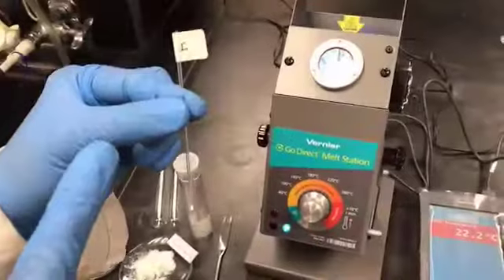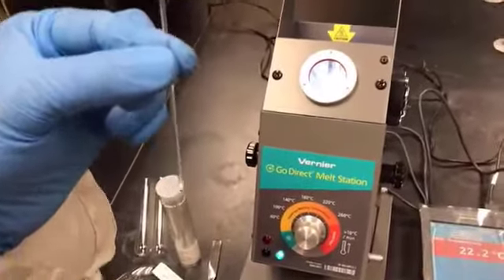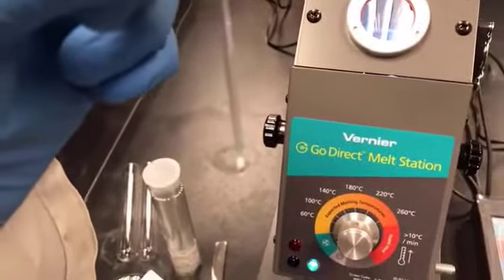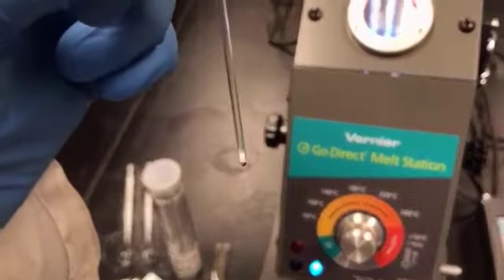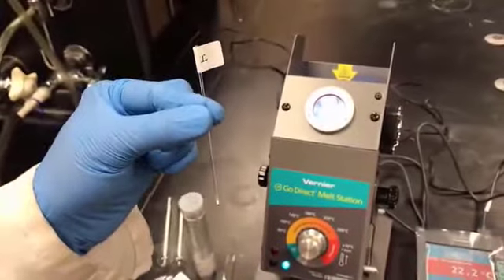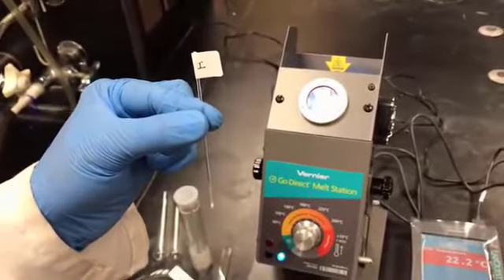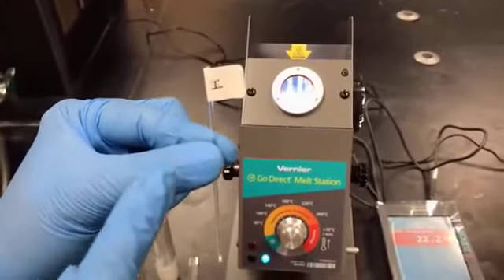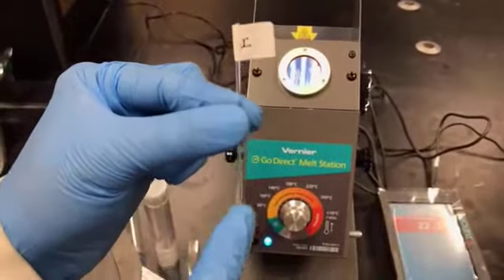After packing through the tapping tube, the height of the sample is about 2 millimeter, and I have checked the length using the ruler. So you can use the ruler to make sure of the length. Again, as I mentioned, if you take too much of the sample, you will never get the correct melting point. Okay, and make sure your capillary tube is labeled.